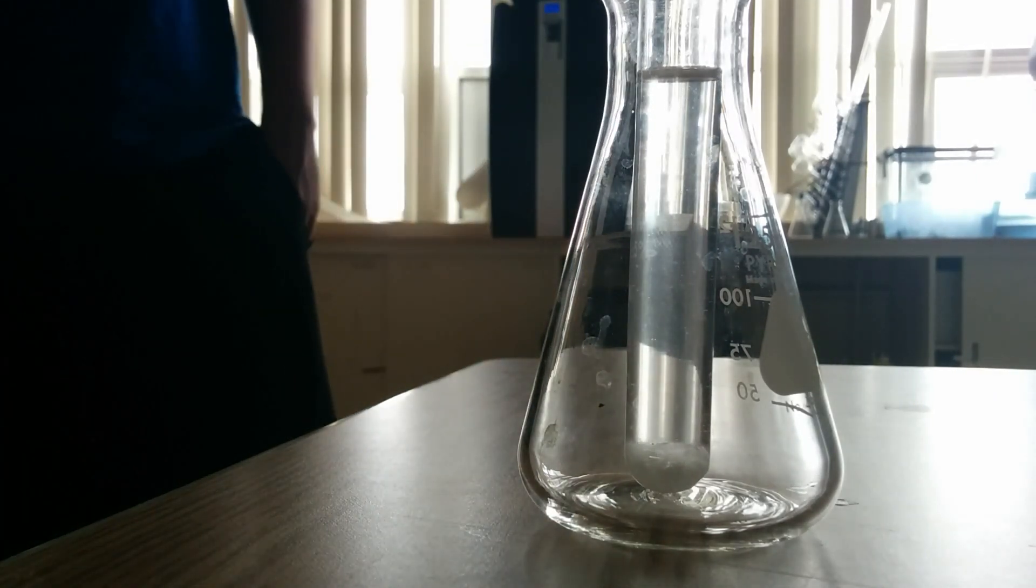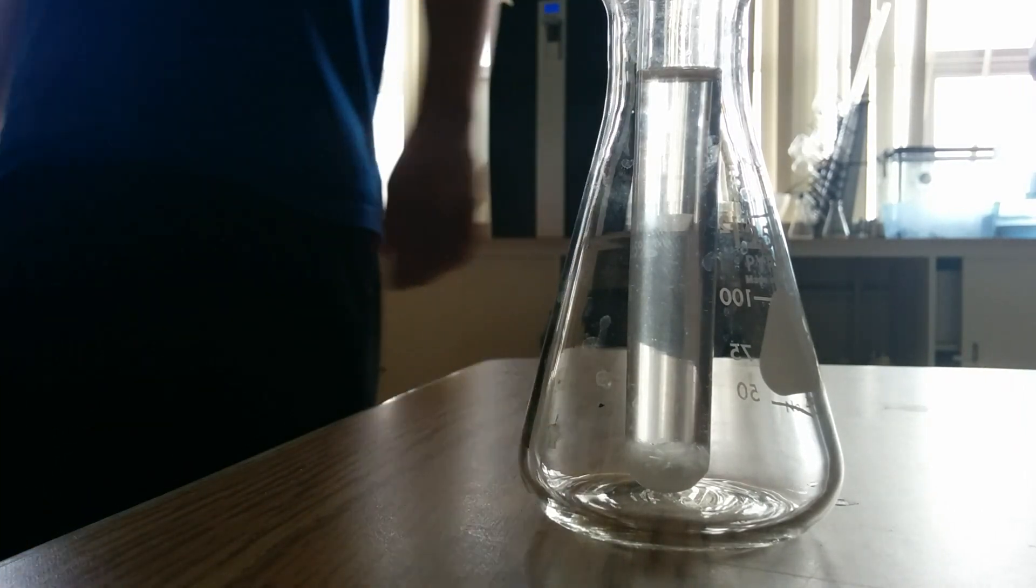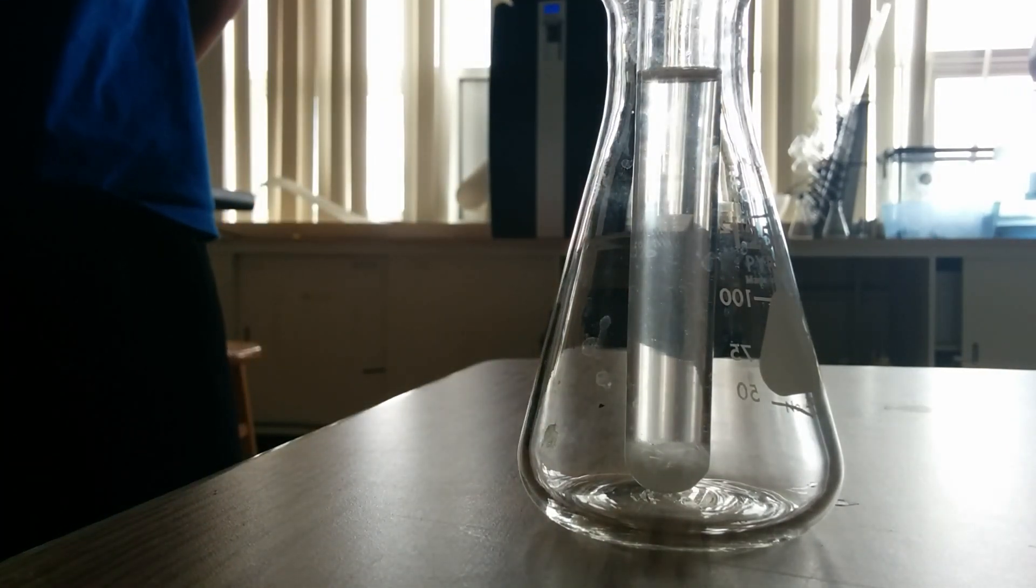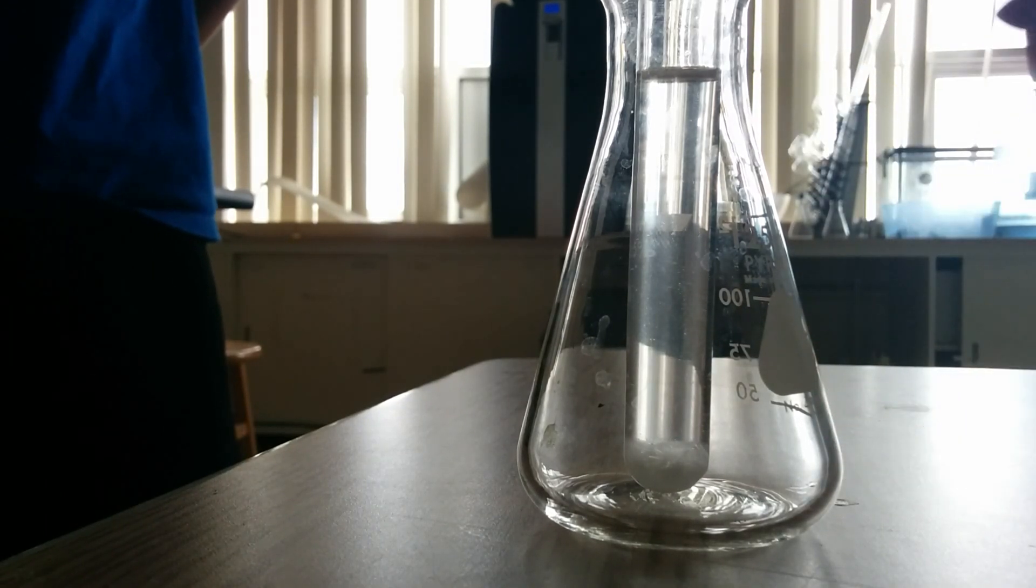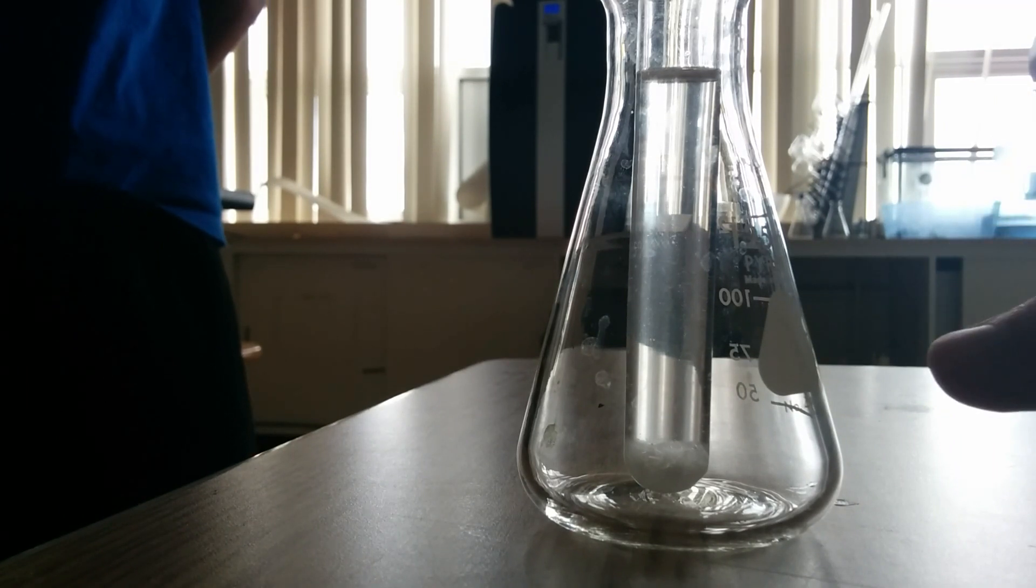Now, I'm not confident it's going to crystallize any more than that because we didn't dissolve too much more than we probably could have. But the point is, as soon as crystals got to wherever the solution was supersaturated, the solid precipitated out.